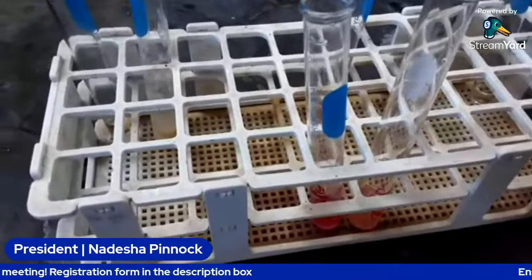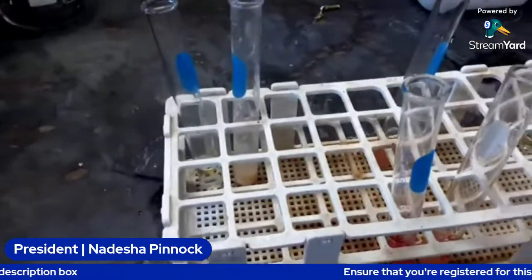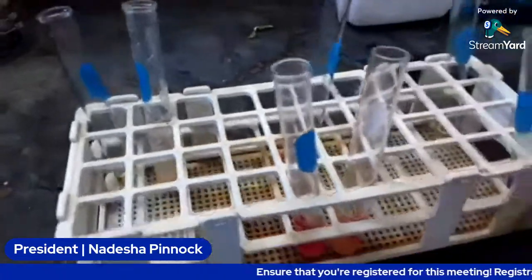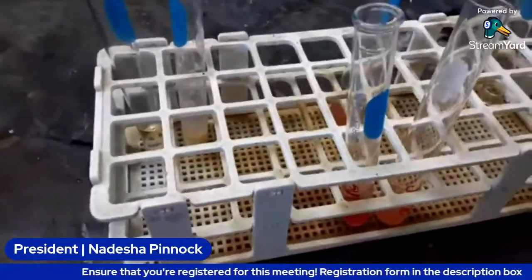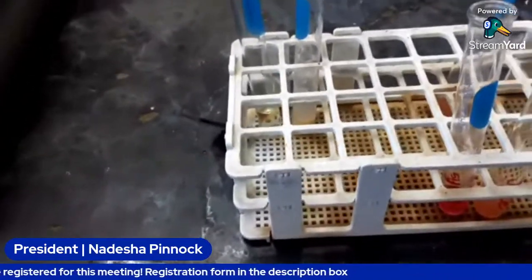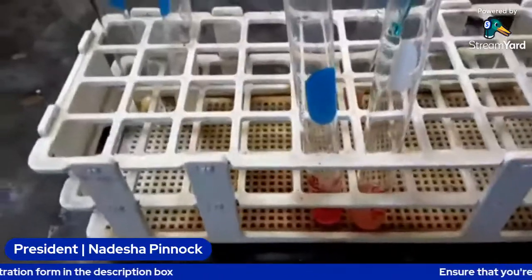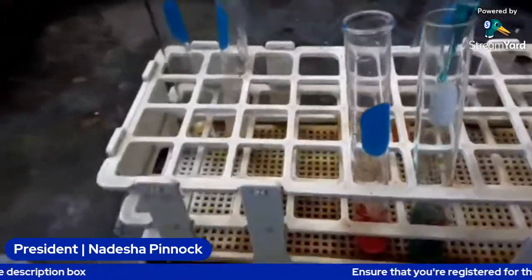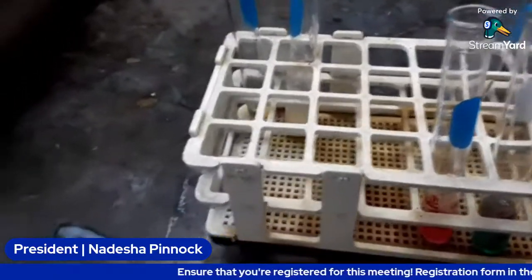Afterwards, we will know whether or not we have a reducing sugar. And if we don't get a positive result for a reducing sugar, then we will do a non-reducing sugar test by adding HCl first. So I'm going to add 3 ml to each of these and also add them to the water bath.